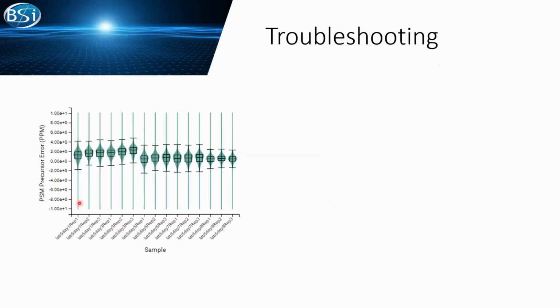So, not the LC issue. Let's look at our mass spec. This is the PSM errors, where the violin chart was plotted, and all the samples are presented here. We can see we have some mass spec accuracy drifting, but it's unlikely to be an error source. All these errors still fall in the plus or minus 5 ppm range, which is the error tolerance set up in our software analysis. So all right, not even the mass spec.